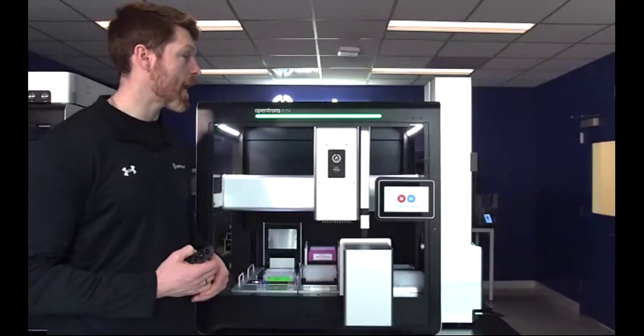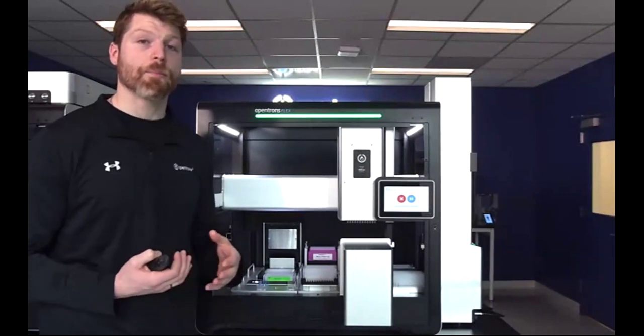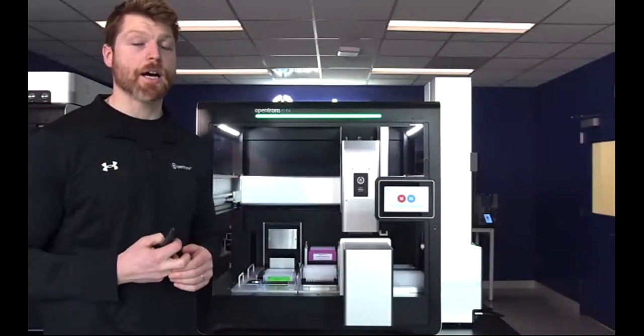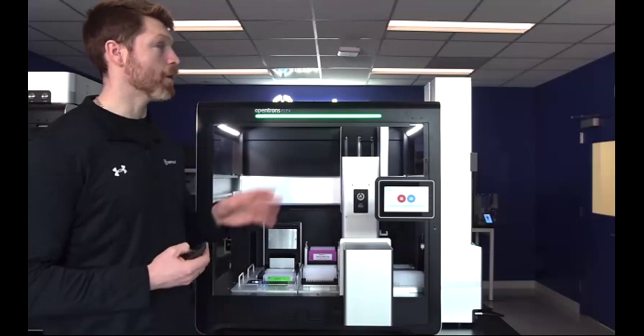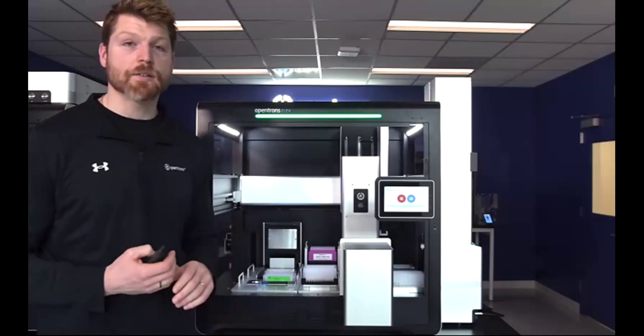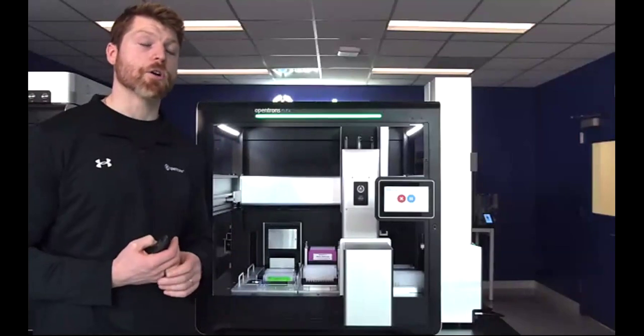One last comment on the stackers is that they will only be able to be loaded with a single kind of labware per run. So if you have one loaded with 200 microliter tips, that is what is going to come out of that for the entirety of it. So in this protocol, we have one that's loaded with 200 microliter tips and one that's loaded with 50 microliter tips. This is just for ease of use and also ease of loading throughout the protocol.